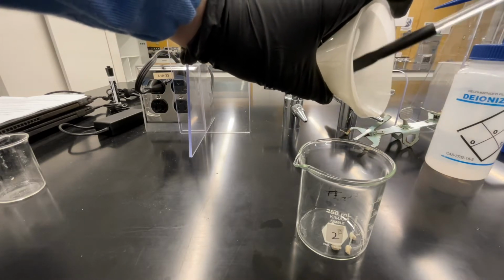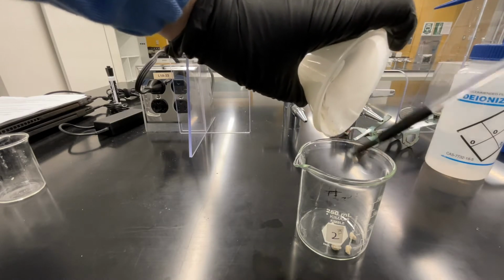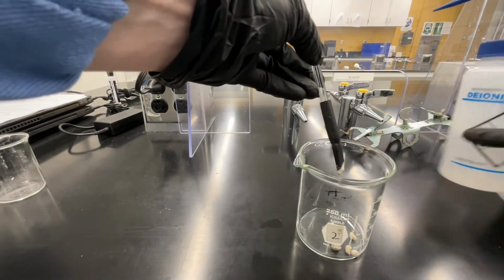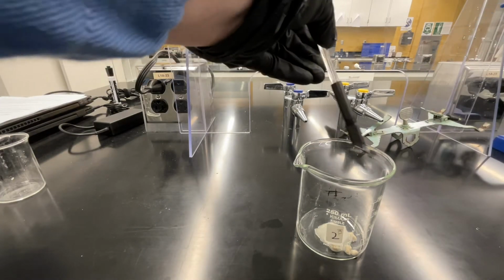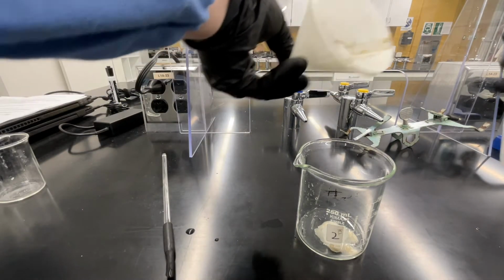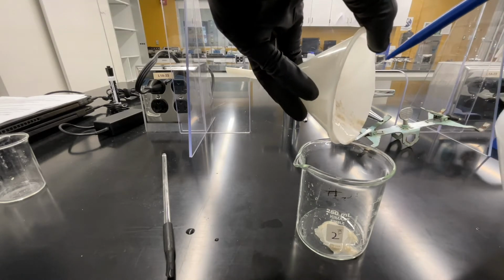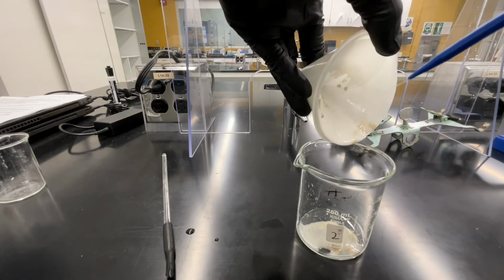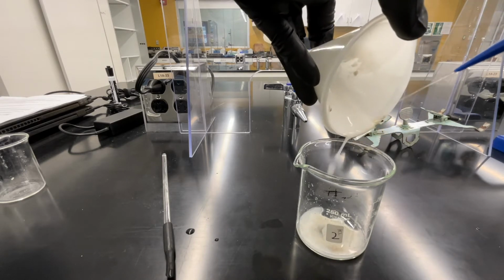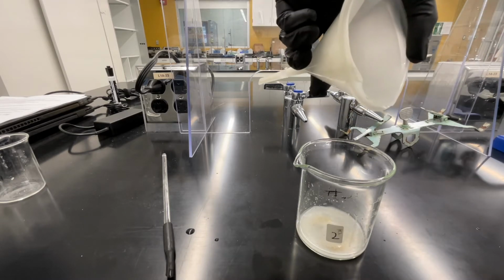Once you've transferred most of the solid into your beaker, rinse any residual solid off of the rubber policeman using a very small amount of deionized water. We don't want to add too much deionized water here, so really be conservative with the amounts that you're using. You're again going to use a small amount of DI water to rinse out any residual solid from your filter paper. Use small amounts and tiny squirts to transfer all of the solid from your filter paper into beaker number 2.